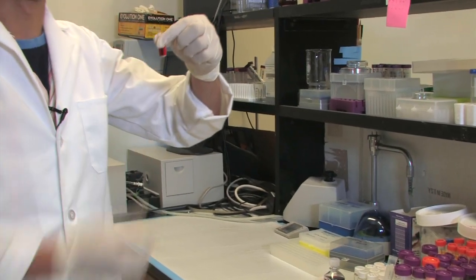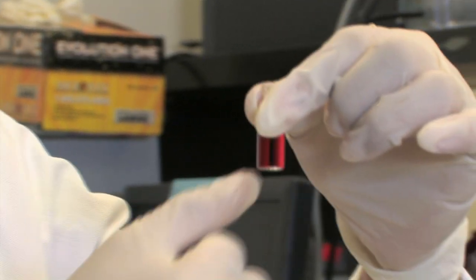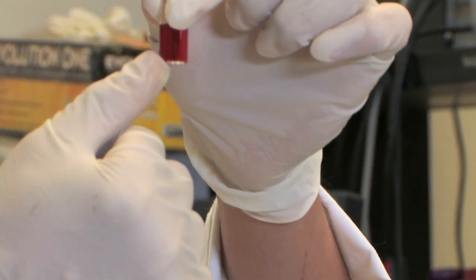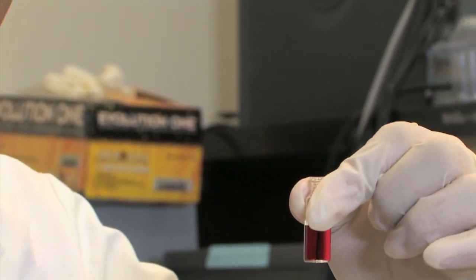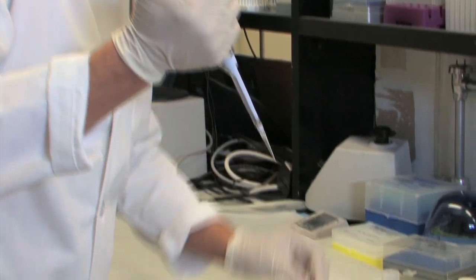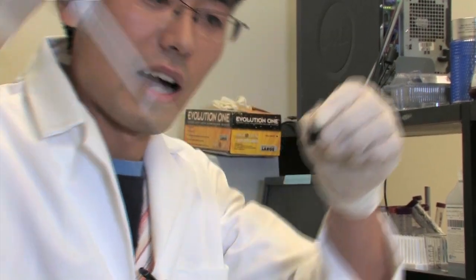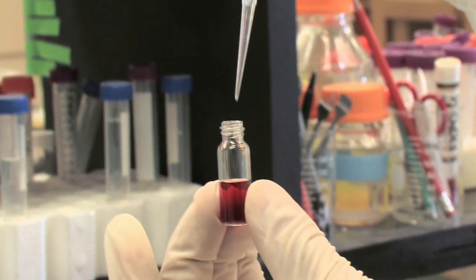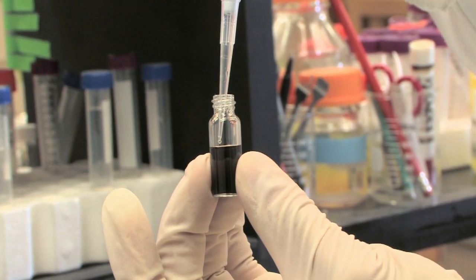Here is the solution of a gold nanoparticle. This is made of nanoscale sized gold nanoparticles and shows a red color. We combine this nanoparticle with functional DNA to make sensors. We're going to show an addition of some targets. It will give an instant color change. By seeing this color change, we will know how much target is in it and we can make a biosensor out of it.